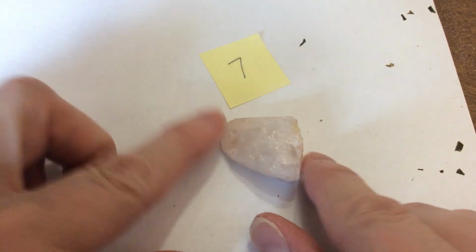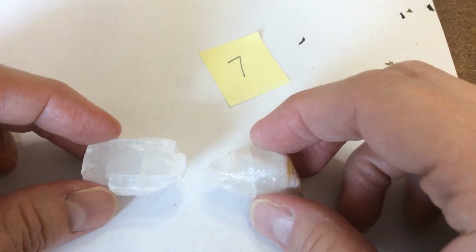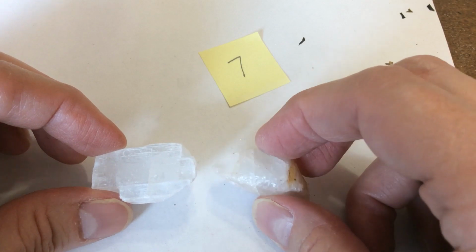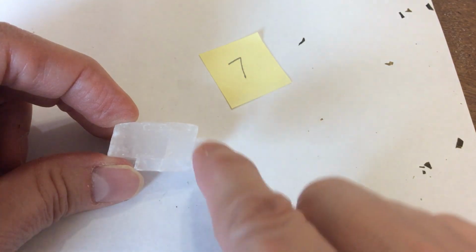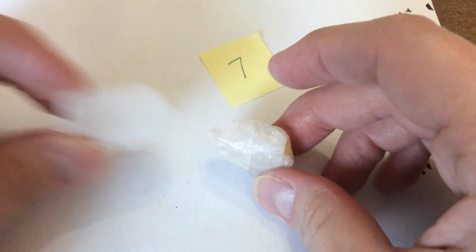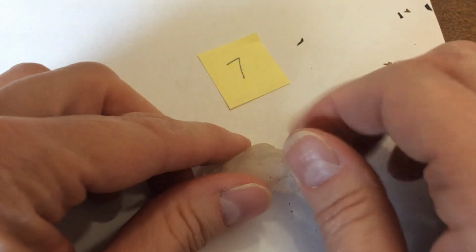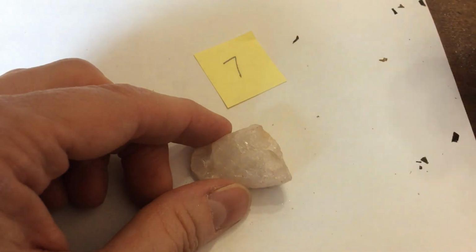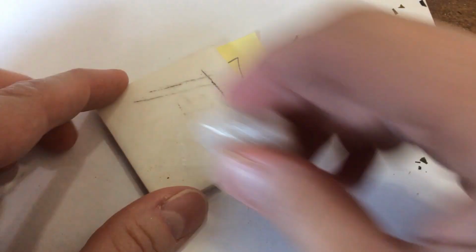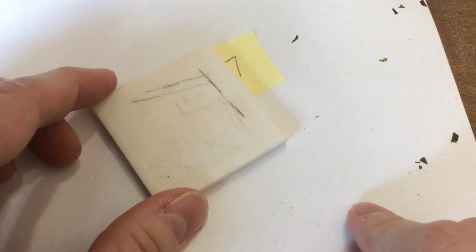Now the first thing I noticed about sample 7 is how much it looks similar to sample 1. This was 1 and this is 7. And both of them are white and both of them are vitreous. But there is a clear, distinct difference between them, and it has to do with those cleavage patterns. Sample 1 has a clear cleavage pattern, but sample 7 is uneven in its cleavage. So that would be a distinguishing factor. So, not magnetic. It's not leaving a streak, so there's no streak. So that was sample number 7.